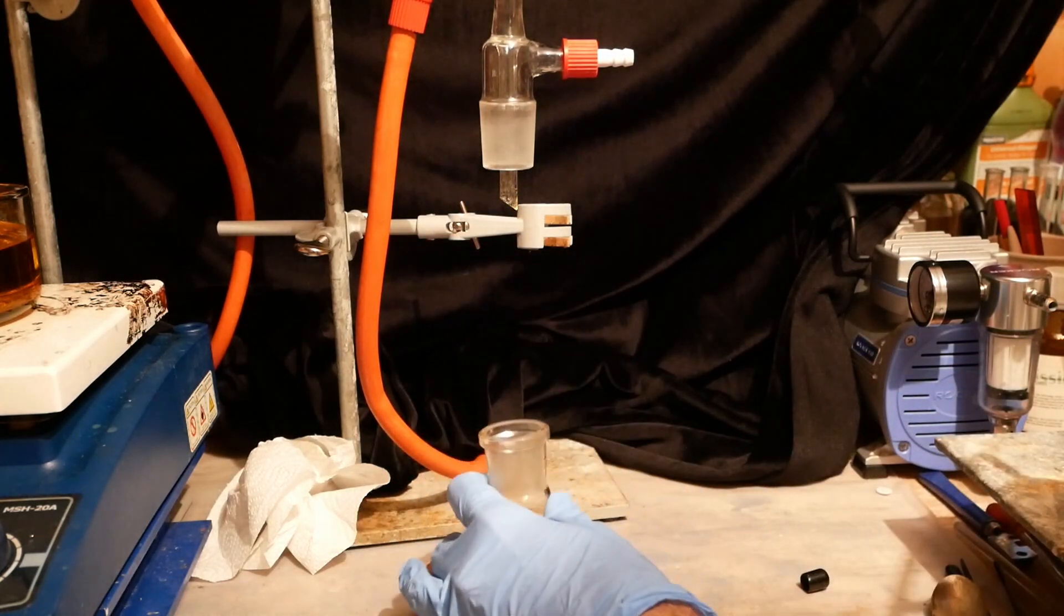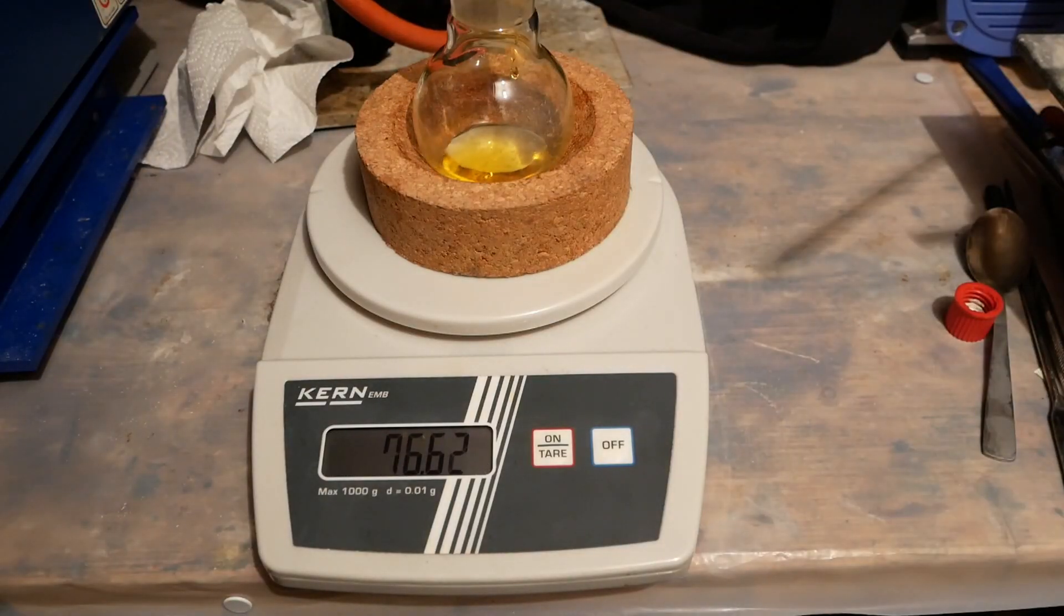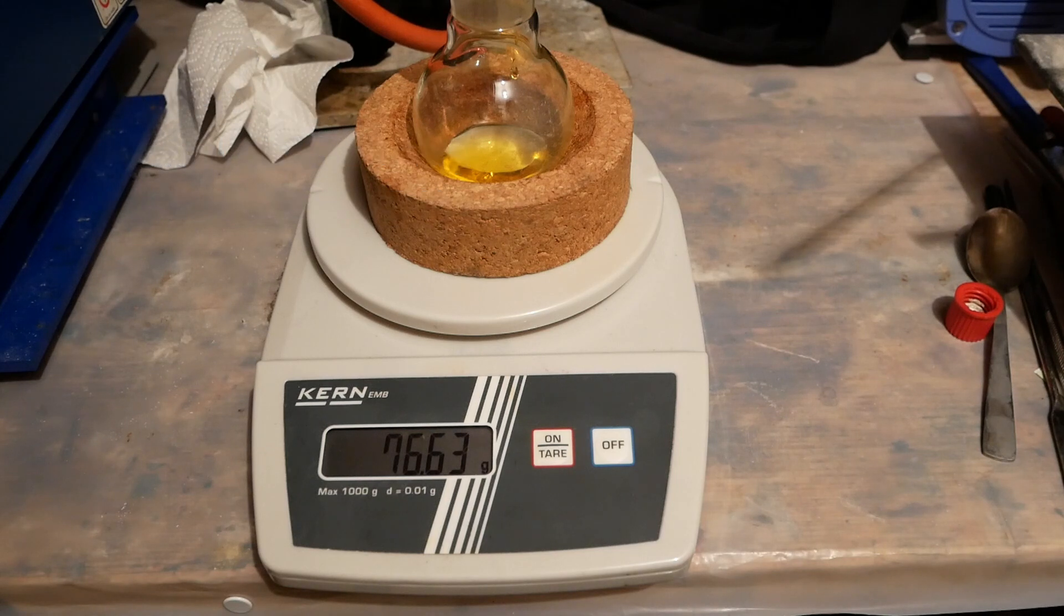Now we get to calculate our yield. We obtain 7.63 grams which corresponds to a percentage yield of 19.85%. This is not very good and I was not satisfied with this result.